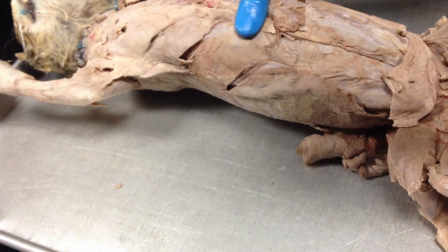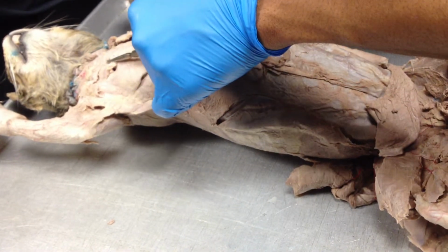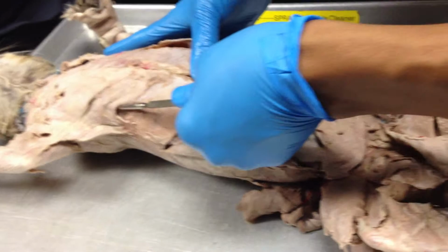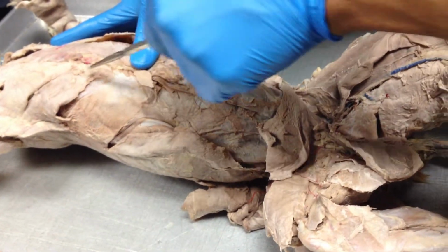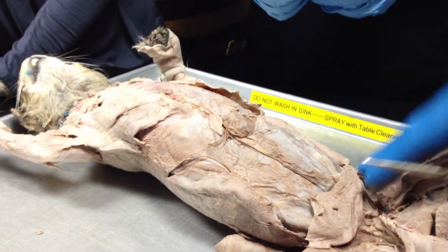Okay, so one difference we should remember when it comes to cat, the pectoralis minor is bigger than the major. Okay, in human, our pectoralis major. That's the xiphohumeralis. Remember the xiphoid process here? That's right. From the sternum. It starts from the xiphoid process, attaches to the humerus. So xiphohumeralis down here. So those are the 4 muscles that we have on the chest here.